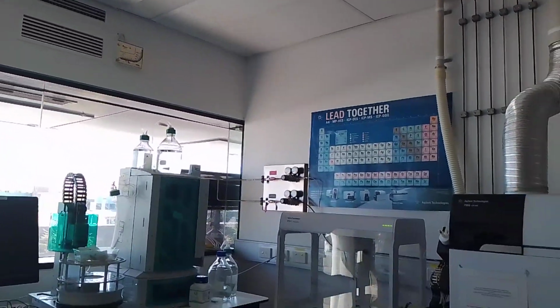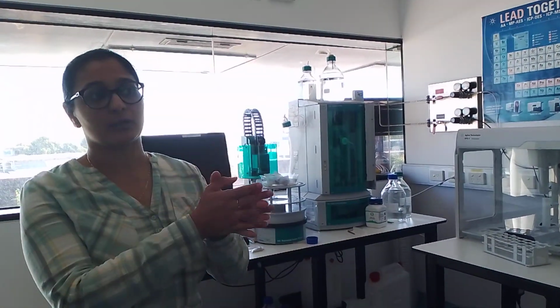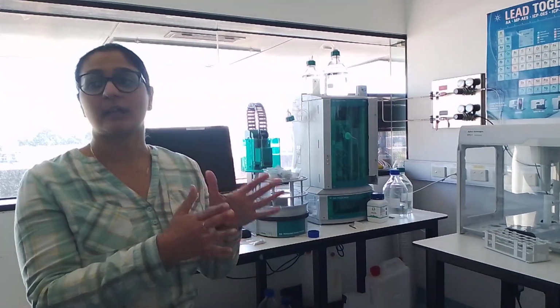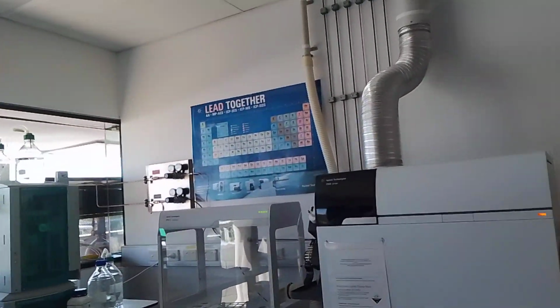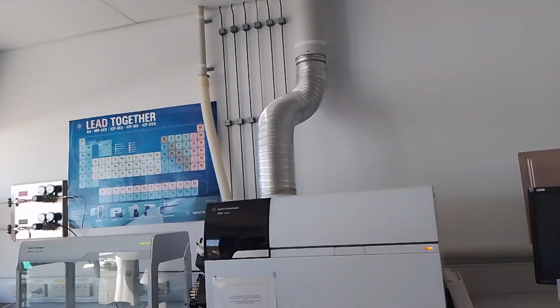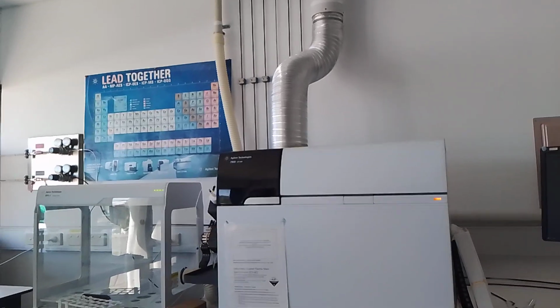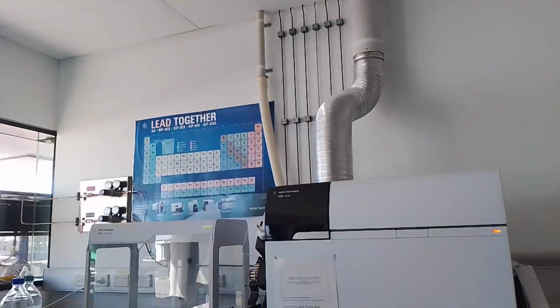Because we are a materials chemistry engineering kind of group, these are the systems we use, and they're very useful in identifying things. So what Alicia was talking about earlier, humic acids, and ensuring they have the right quality standards for industrial scale use that the companies sell. They have to get certified, and we can use these equipments to ensure that they have the right quality standards for their humic acids or other materials that they are trying to sell into the market.